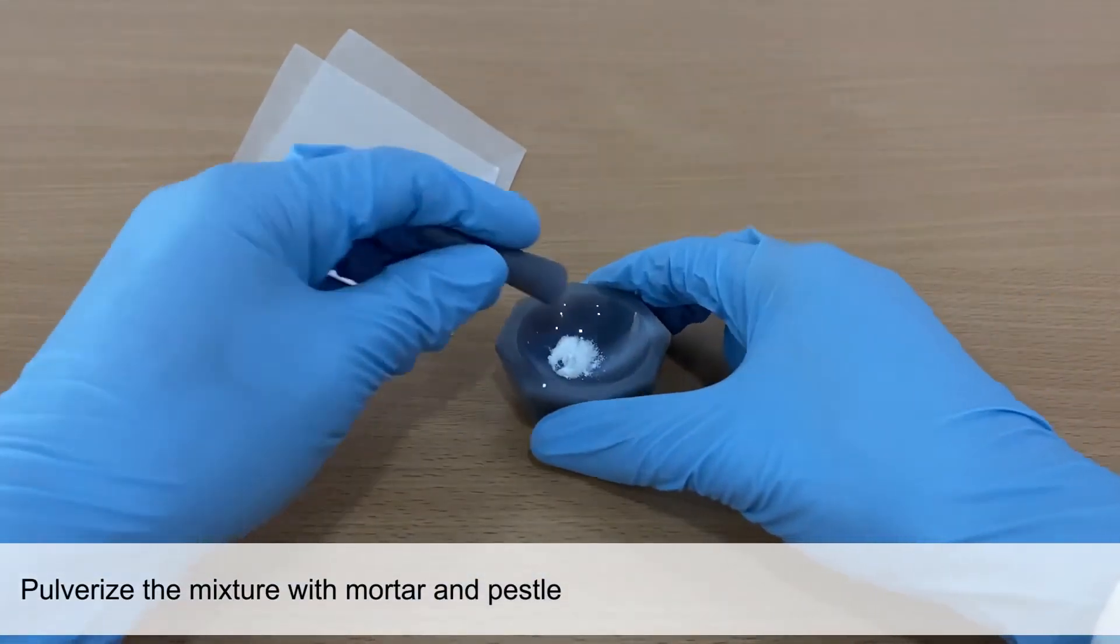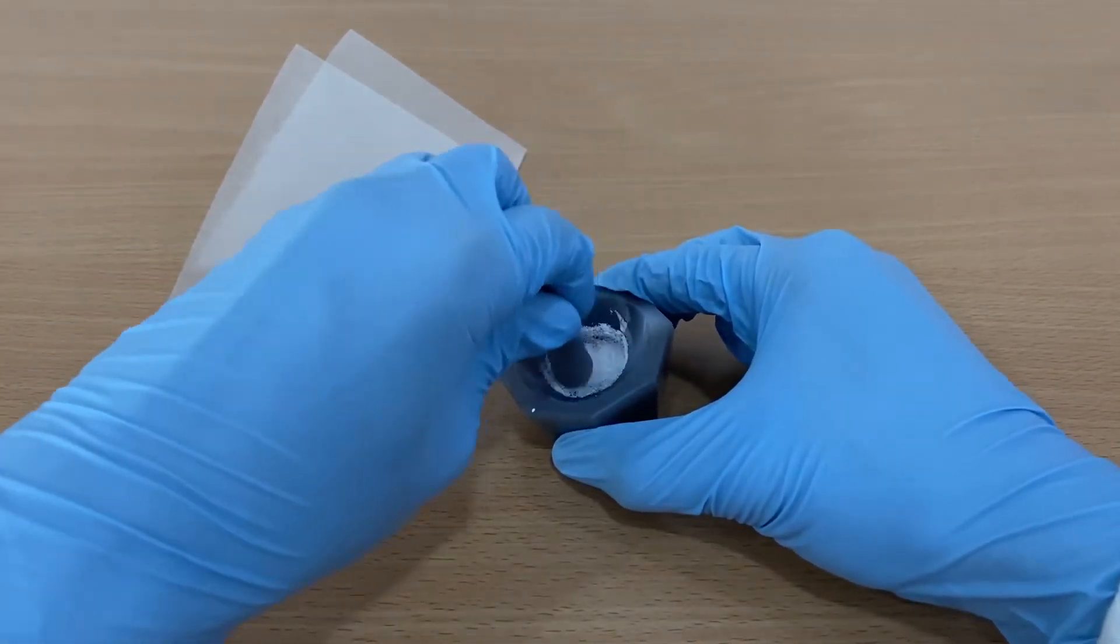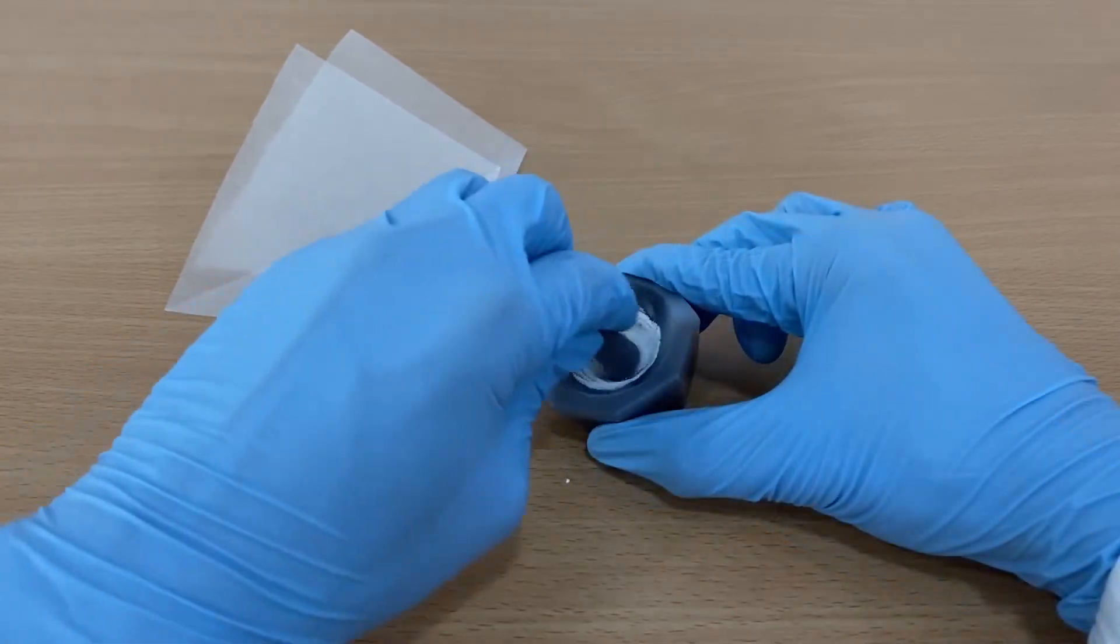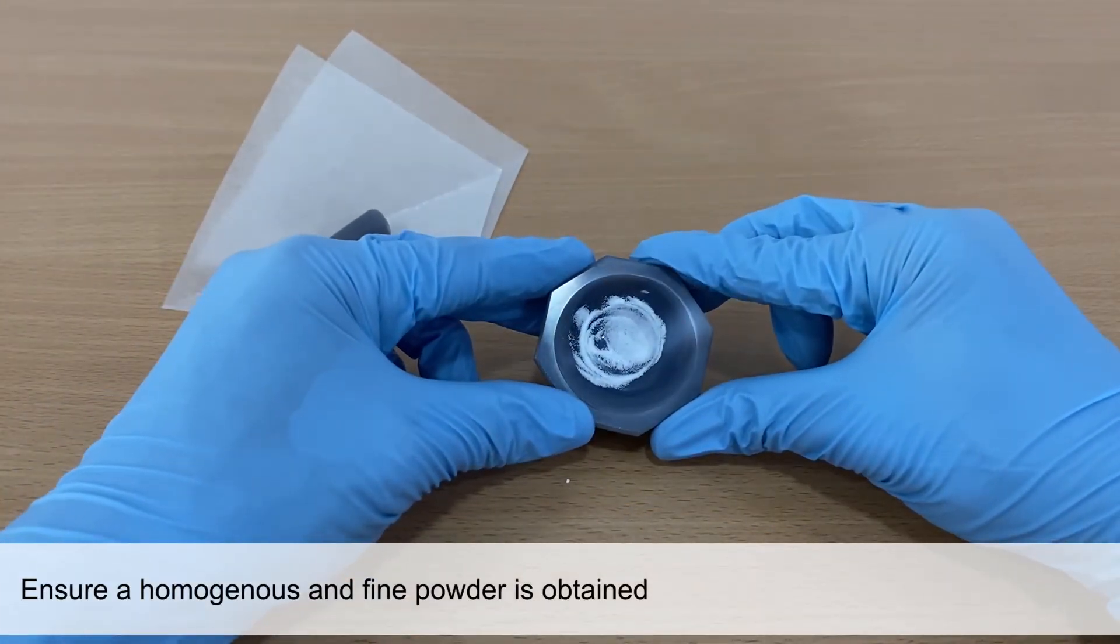The powder mixture is then pulverized using a mortar and pestle. Ensure a homogenous and fine powder mixture is obtained, as shown.